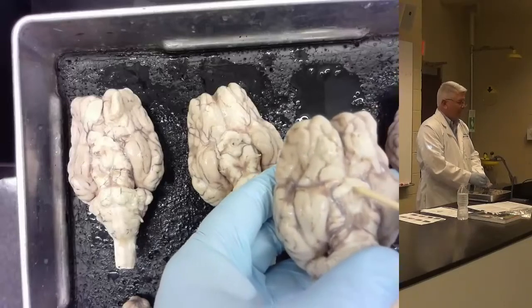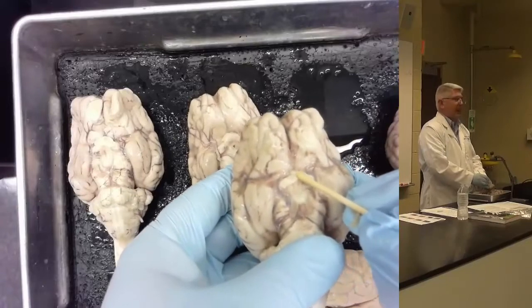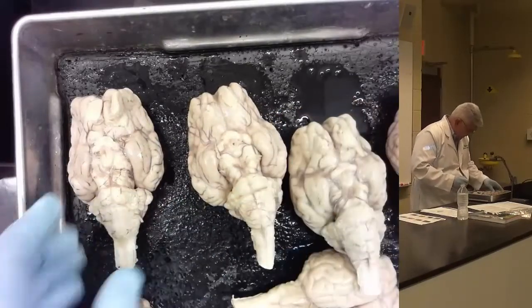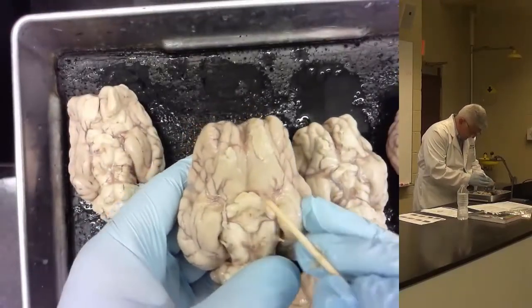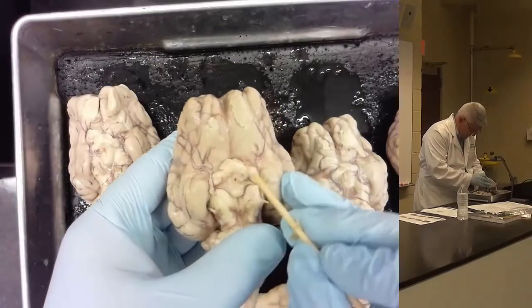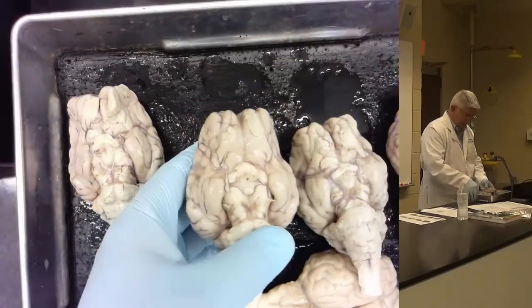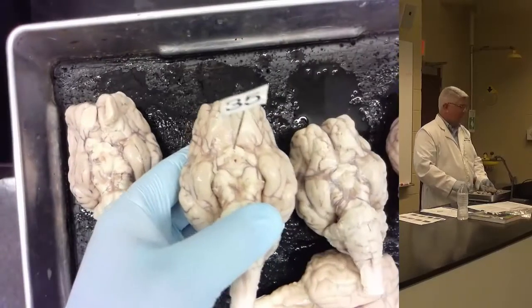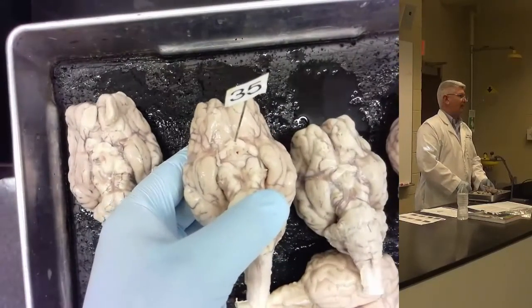This in the longitudinal fissure, this big white X almost looking structure, if they hadn't cut the nerves off, is the optic nerves and the optic tract, and right in the middle is the optic chiasm. And in some sheep brains it makes a better X. This one you can kind of see the X where they cut the nerve. This is the optic tract. This is the optic chiasm. So if I was marking optic chiasm, it would be midline, right in the middle of optic nerves and tract, right at the center, X.